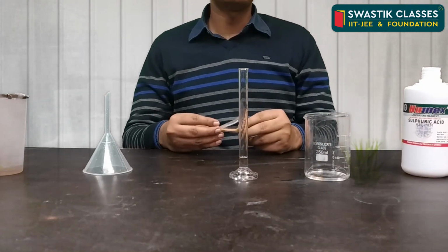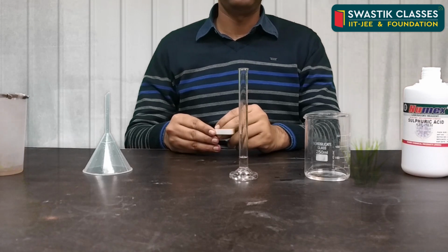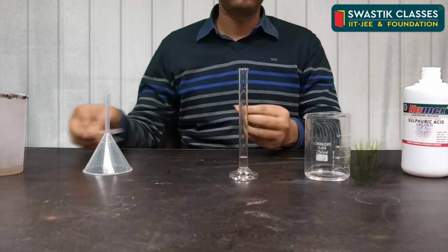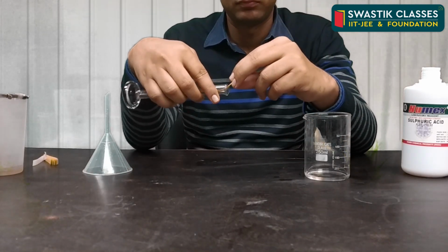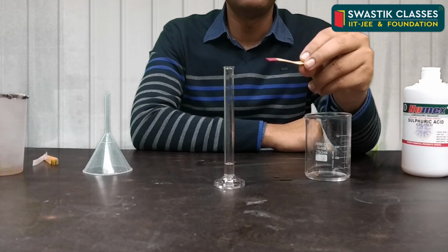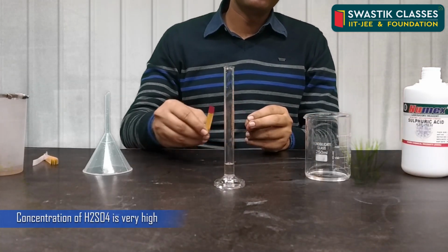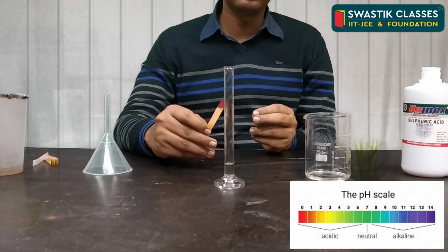I have taken universal pH paper, and let's check the pH of this resulting solution. The color appears intense red, which means concentration of H2SO4 is more, and the nature of this solution is acidic.